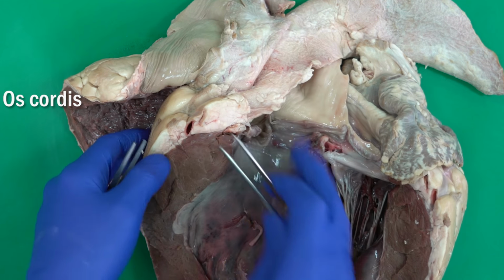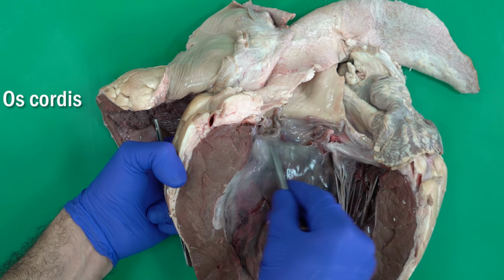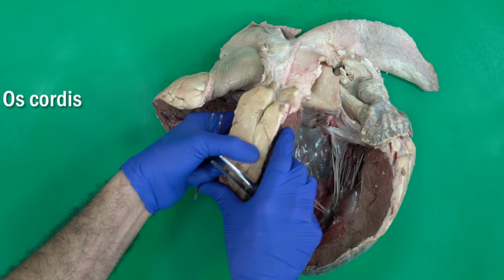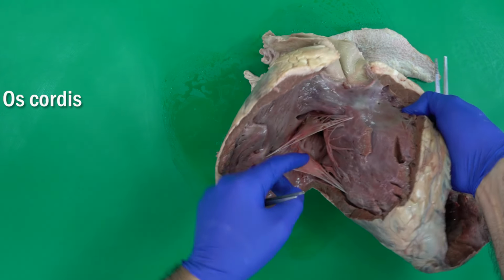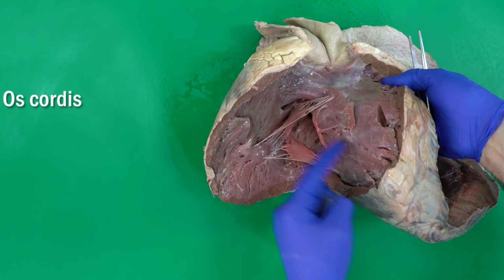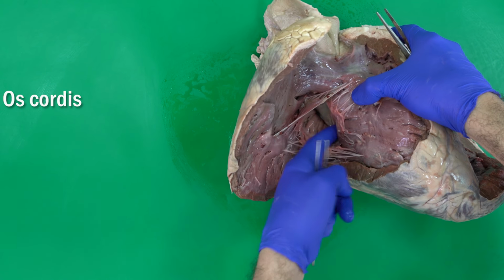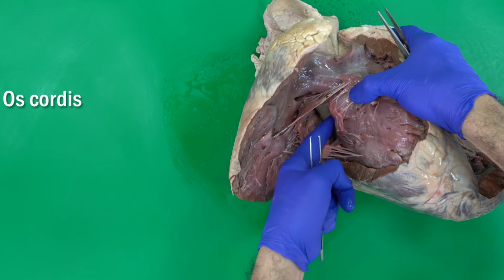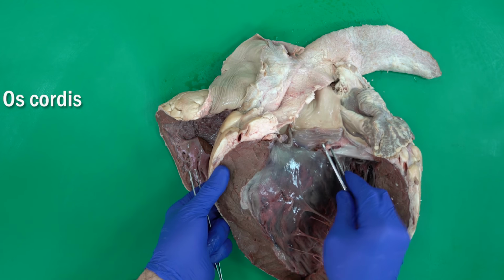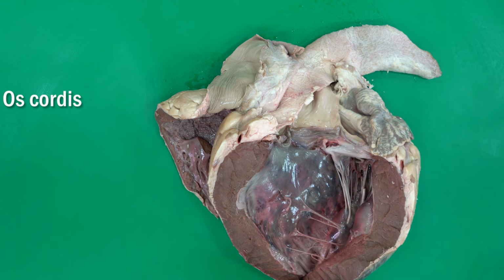It's somewhat rounded. It moves into the ventricular septum in a way that we can even palpate it from the right side, inside the right ventricle. I can palpate it with my finger there, so that means it also supports the right atrioventricular valve, what's called the tricuspid valve. This is what's called the os cordis, very developed in the ox and even the camel.